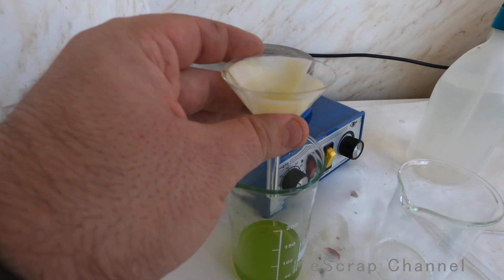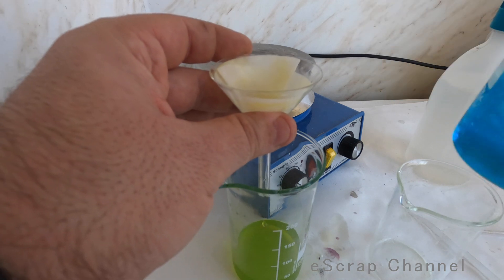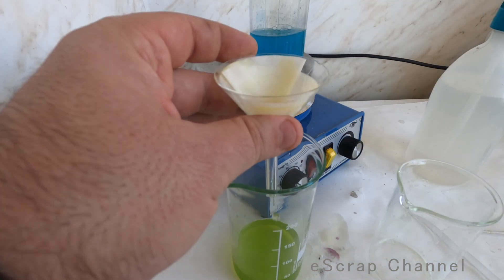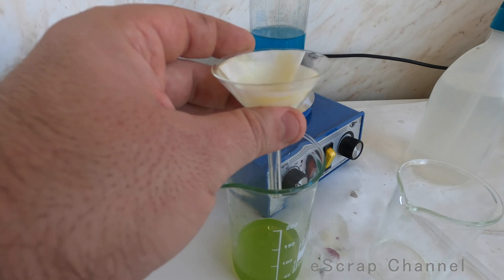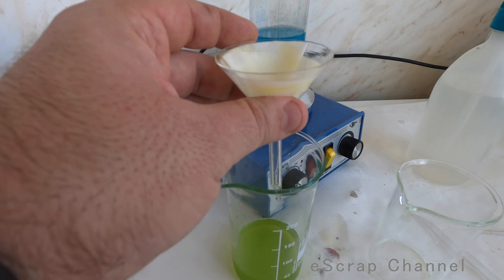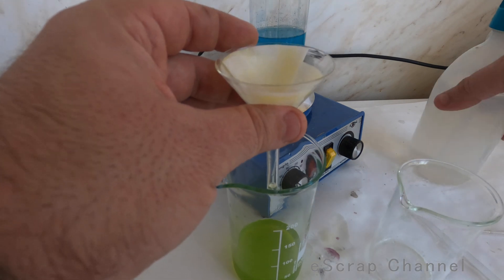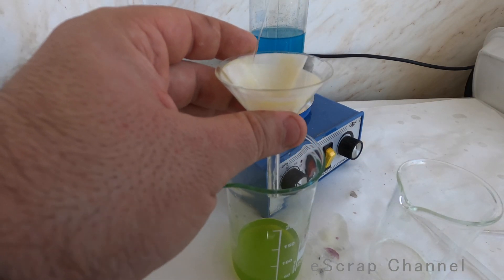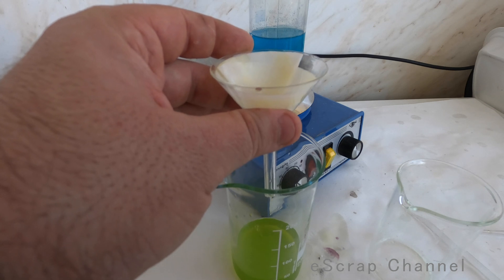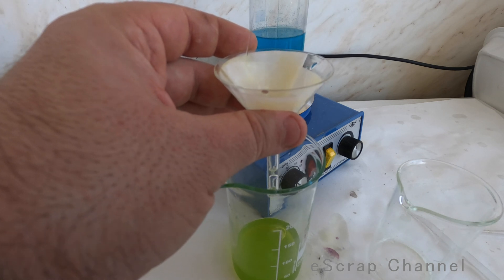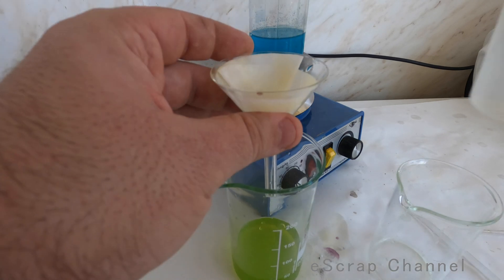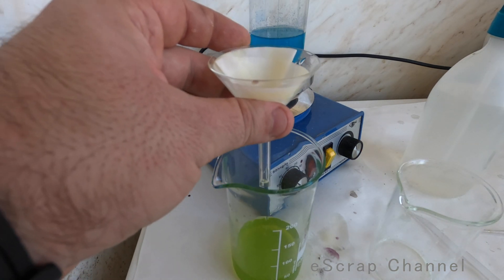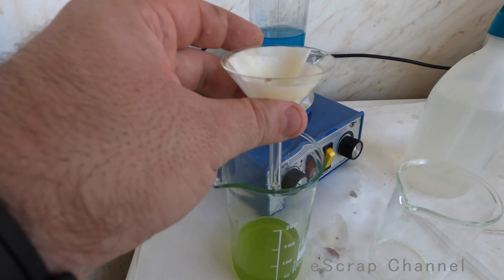So let me also show you the silver. It's here. This is silver chloride in nitric acid. I will also recover the silver for him but to be honest with you, gold is more interesting to me. I am really curious how much gold he was about to throw away because he said I'm not able to see gold. I'm seeing something black coming out. What's wrong here?